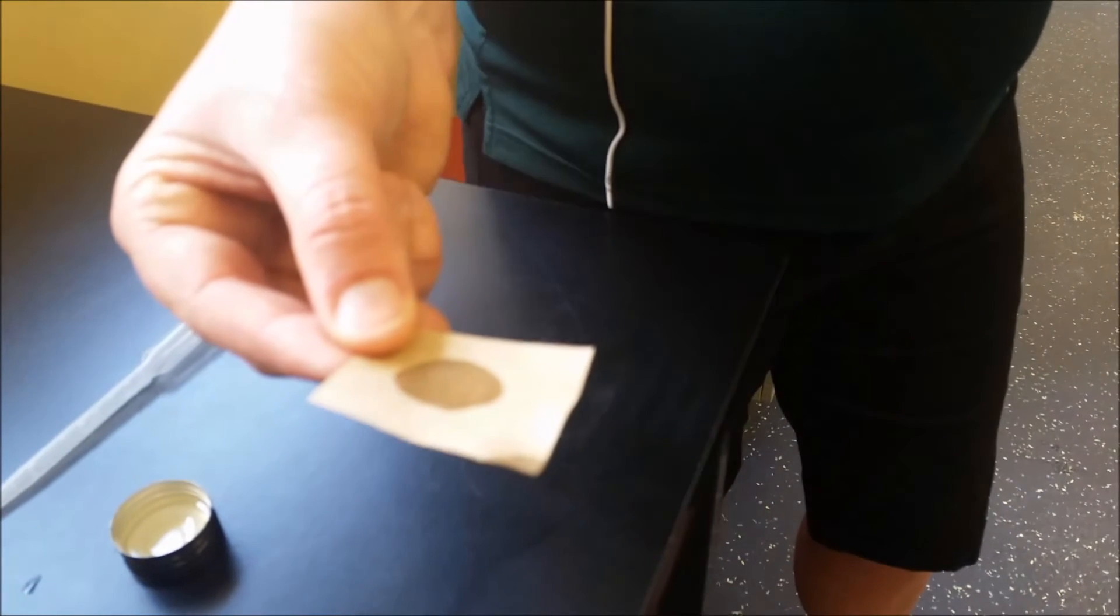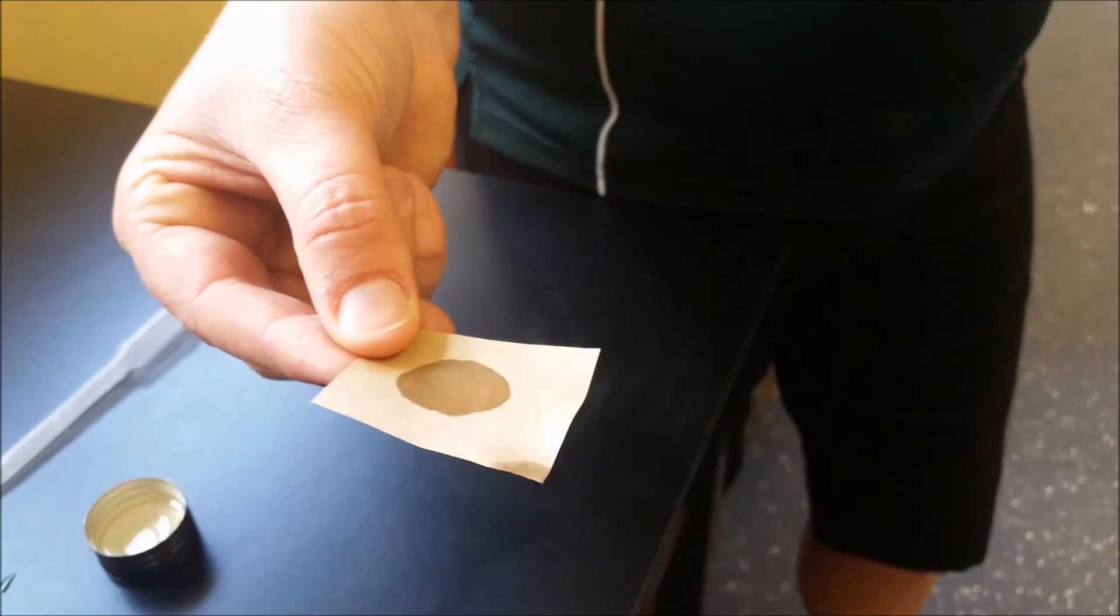I am just doing this because I know that this will give us the positive test result. With your food, if it is a harder food, rub it onto the brown paper.